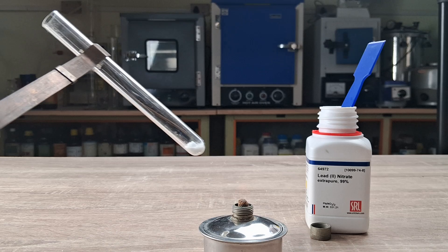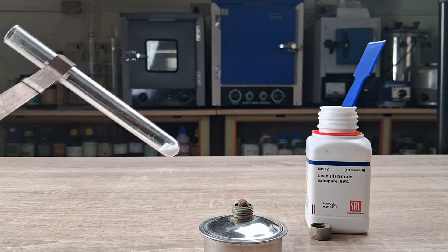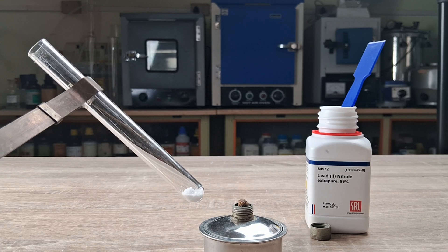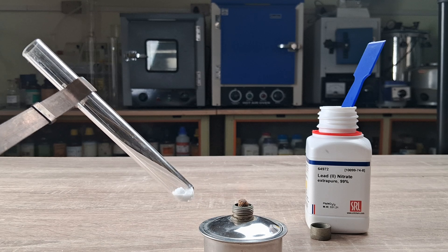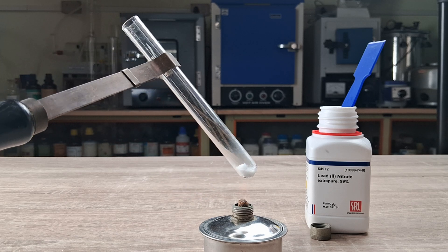To perform the experiment, take half a spatula of lead nitrate salt in a test tube. Hold the tube using a test tube holder. Begin heating the salt on the flame of the Bunsen burner or spirit lamp.